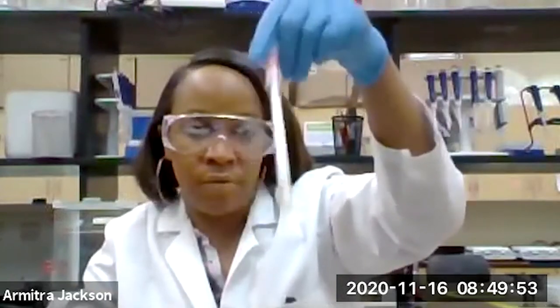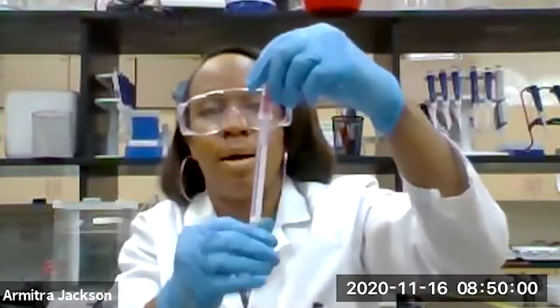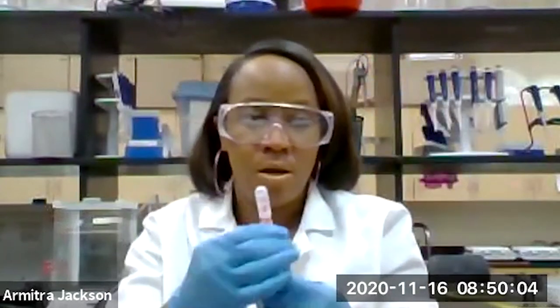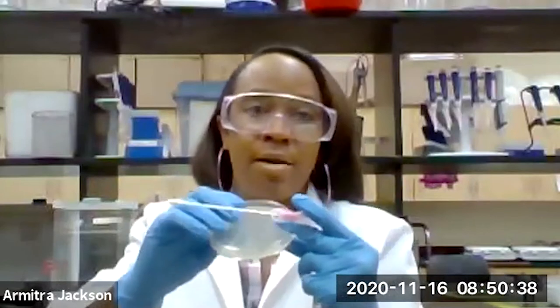You can also use the 3M Petri Film with this as well, but we're just streaking on media so you can get practice with streaking and using the swabs at the same time. We're going to take our petri dish with the SPC media — you'll be using only SPC for this — and just streak using the zigzag motion. Afterwards, place the lid on and we will incubate these for 24 hours at 37 degrees Celsius to see what we get.